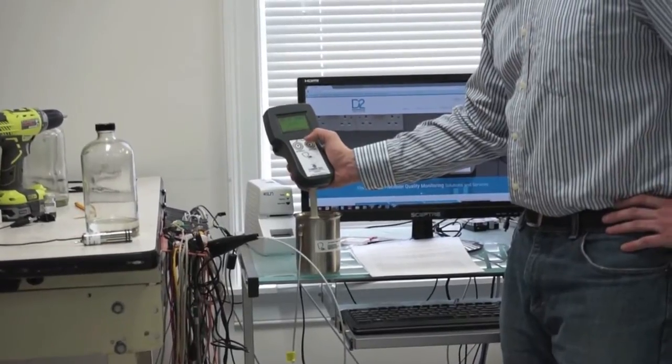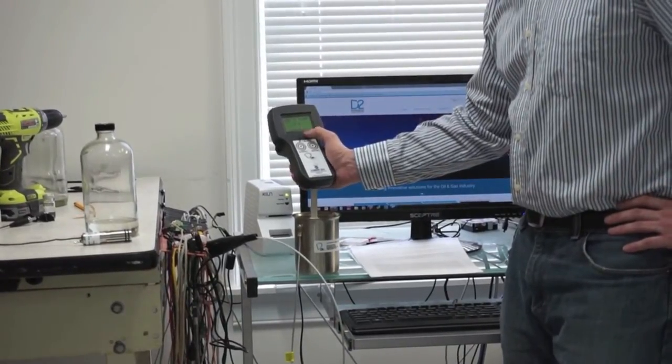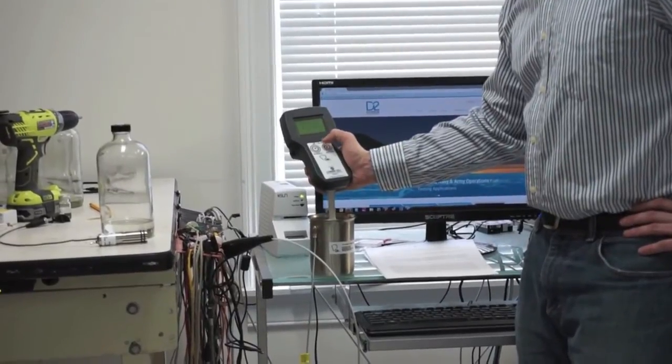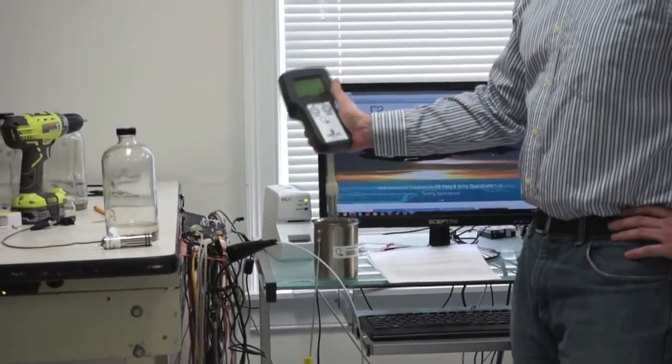Once the unit is in there, you'll see a bar with an arrow. Once those are lined up, you're going to hit enter, which gives you the result.